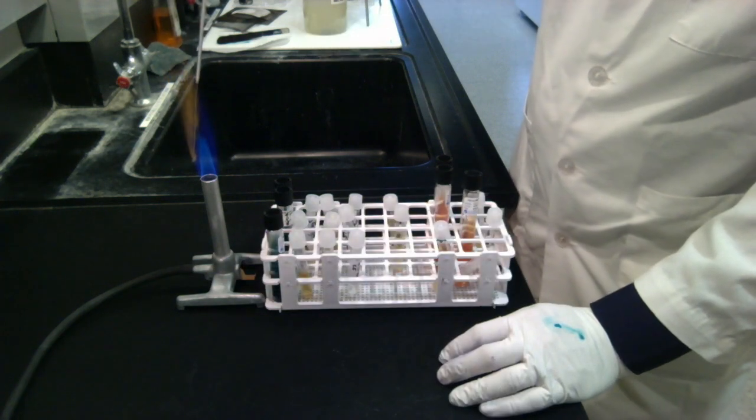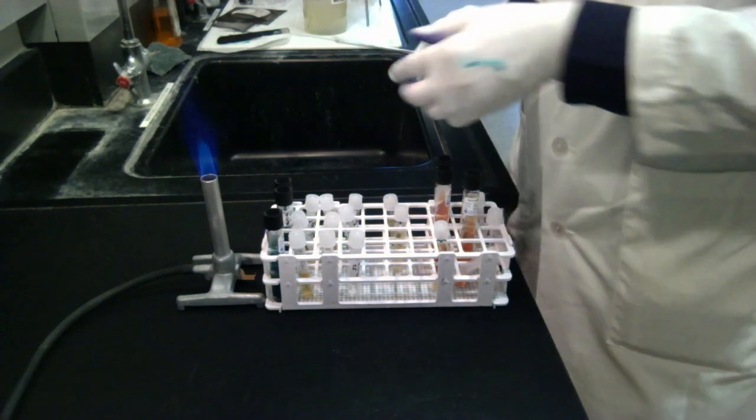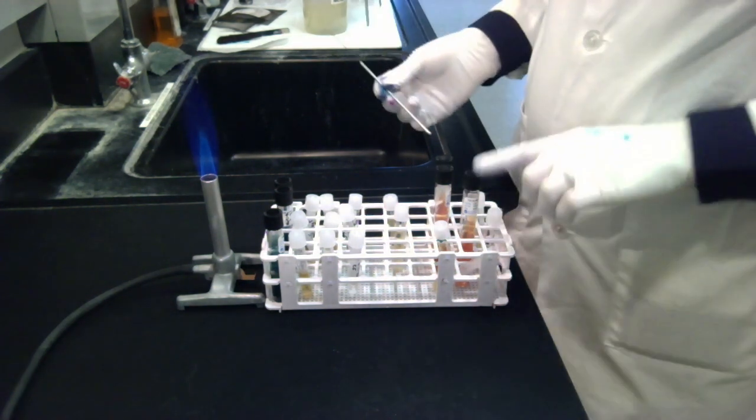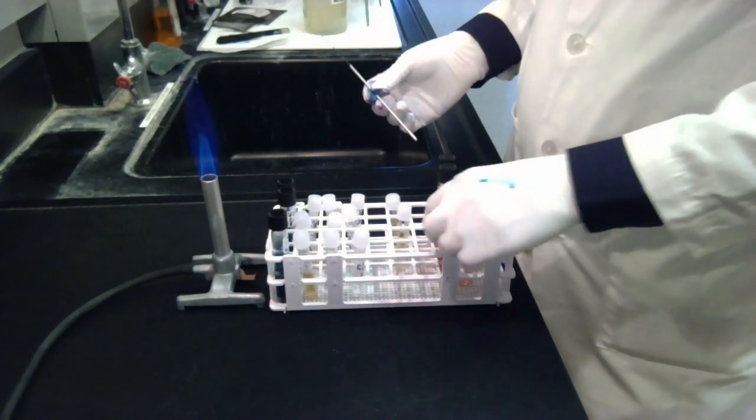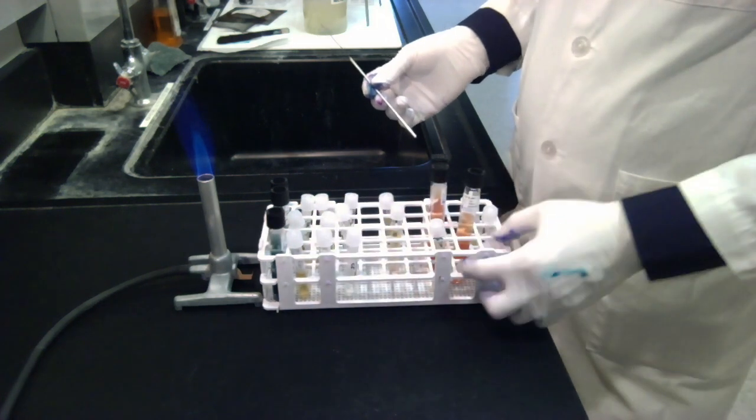Flame your loop. And you have finished inoculating the TSIA, the SIM, and the IMVIC for one of your bacteria.